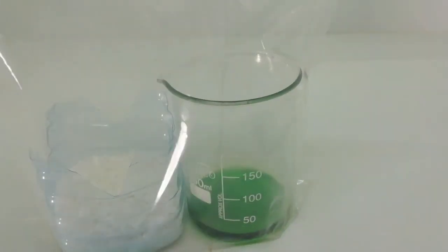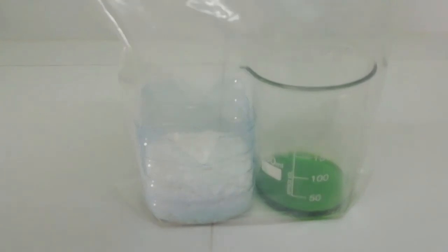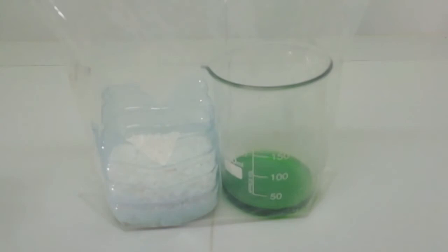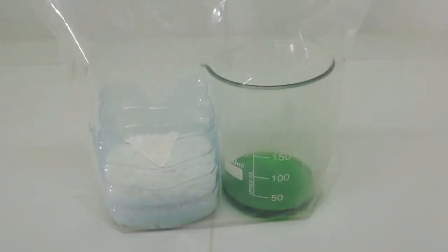And now this calcium chloride ziplock bag acts as a desiccator. So let's keep this solution for a few days and let's see the nickel chloride crystals.